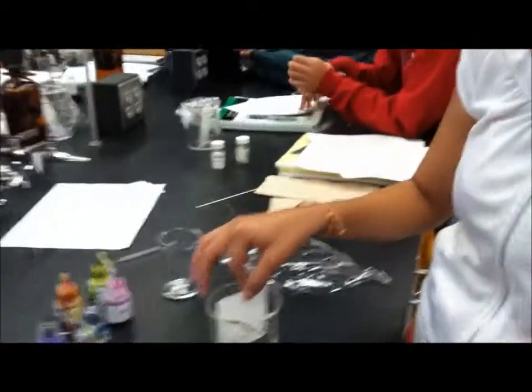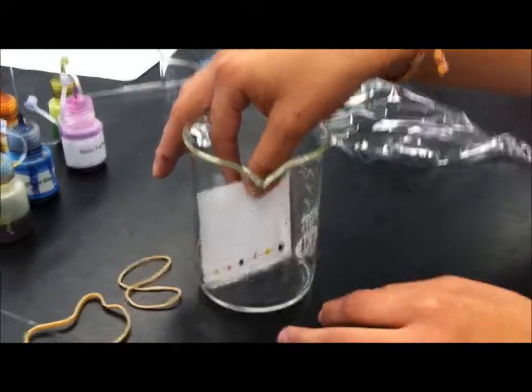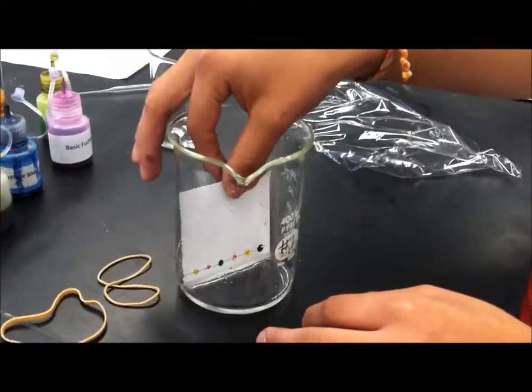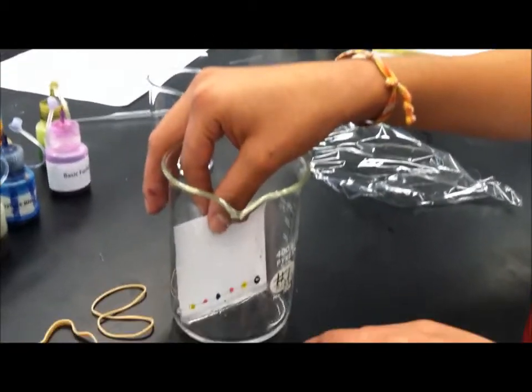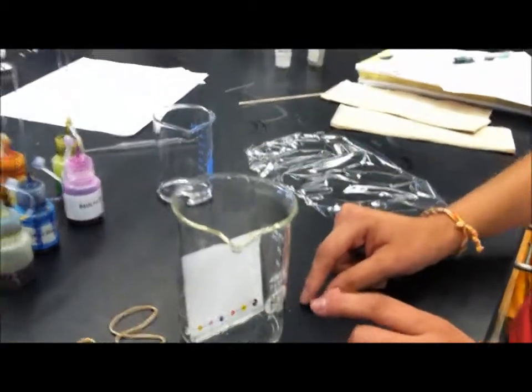After doing so, you'll place the paper plate inside the beaker. Make sure it is sturdy and will not tip over and that the water-acetone does not go above the line or touch the spots.